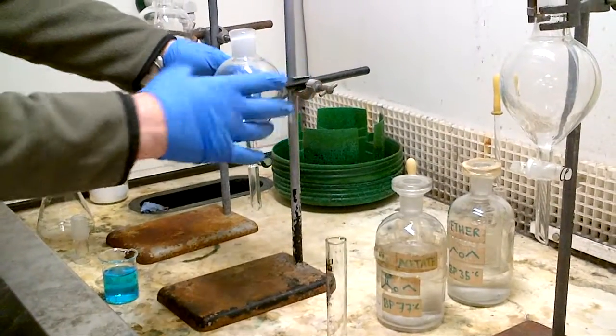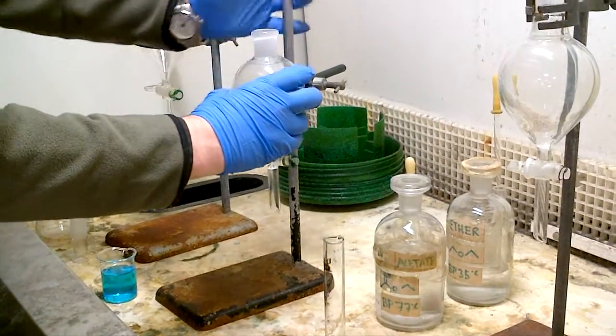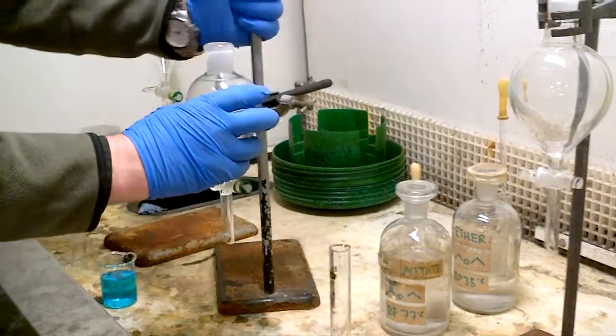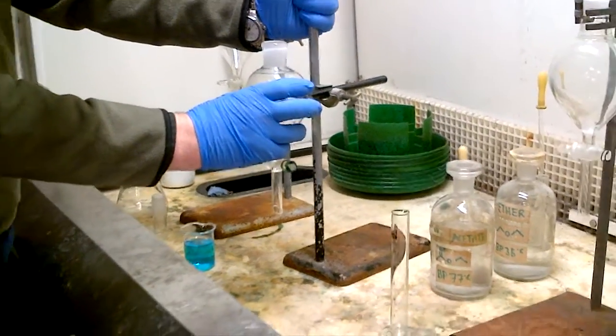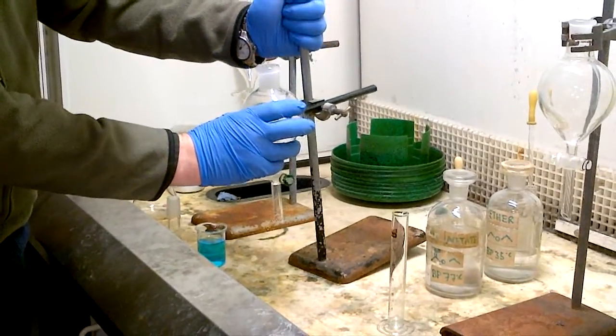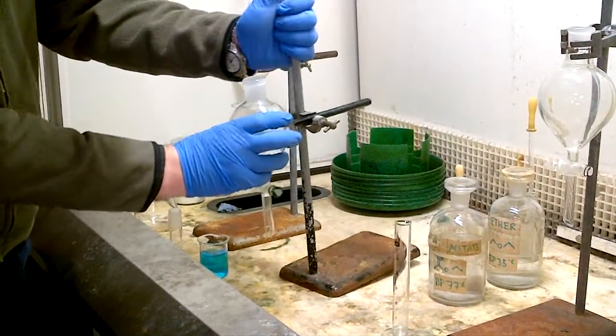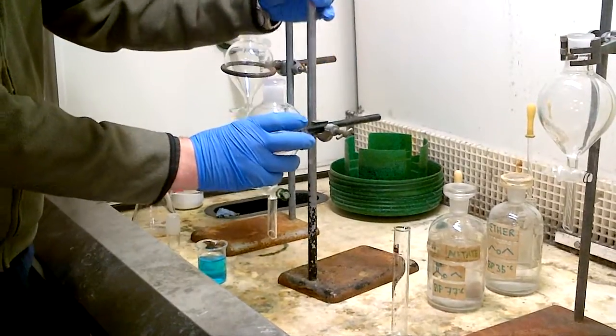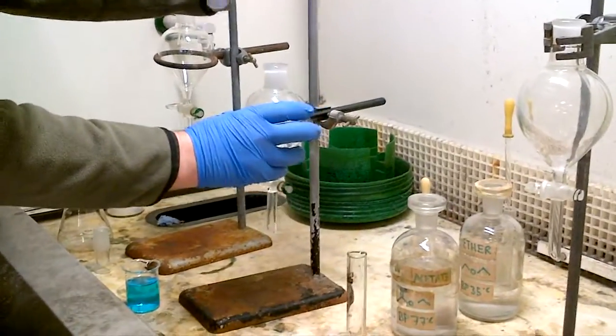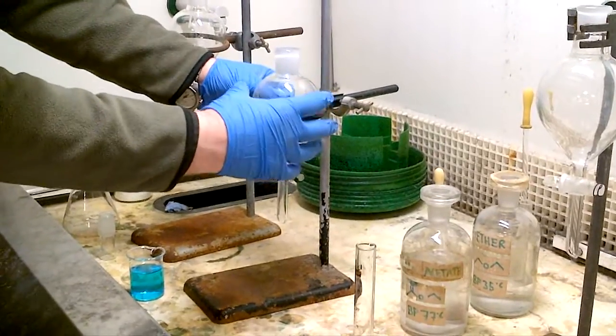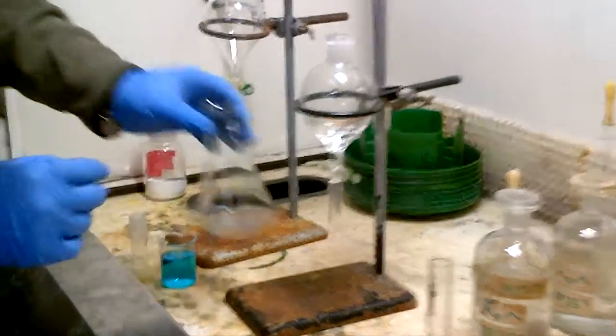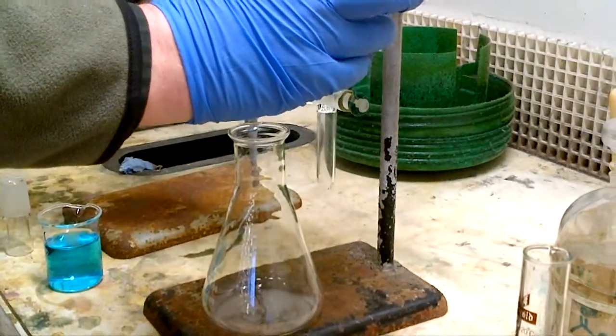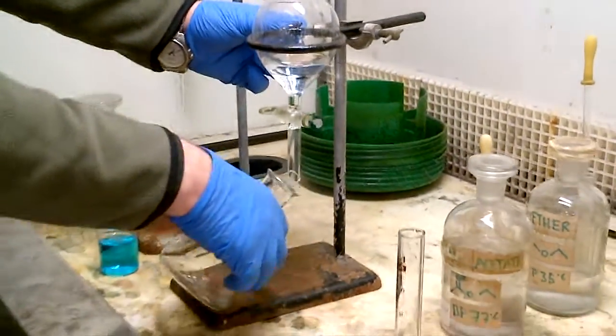What I don't want to see inside of a lab, maybe, is that there's your glassware being clamped. If this was a bigger separating funnel, another litre, two litres, and that was filled with solvent, you do sometimes find that it can rock and wobble around. So we don't want it clamped like that. You want it to be clamped in this position and as well, make sure that you can get any beakers underneath or, appropriately, conical flasks underneath as you need to continue. So make sure it's clamped at the correct height as appropriate.